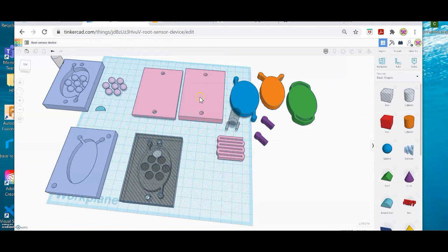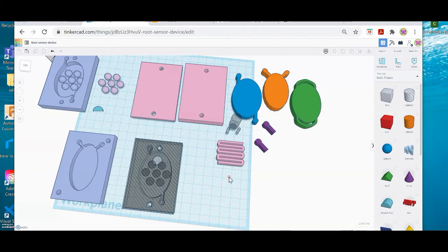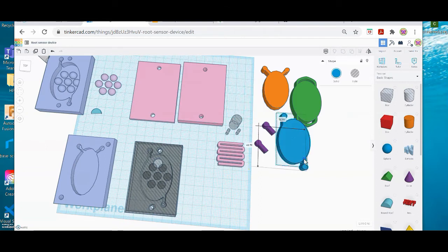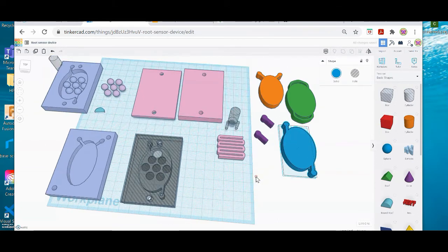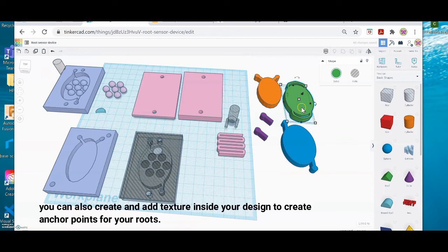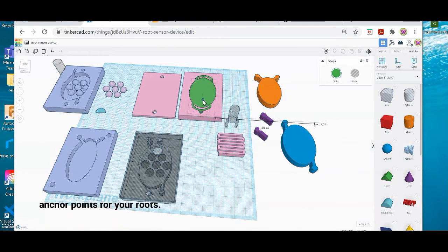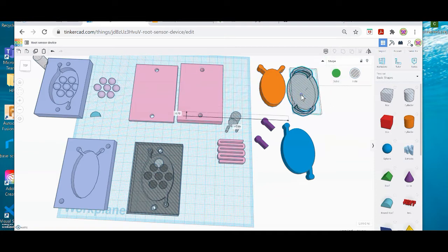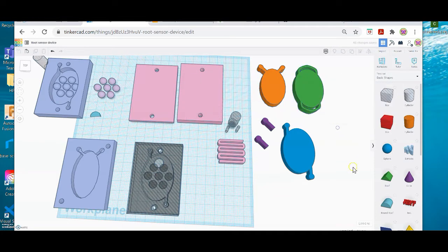So going back to Tinkercad, I want you to think of this like the toy Potato Head. These are the different parts that you can use, and the way you would use these is you decide which one you want to use, and you can slide it over here onto your base plate, and then you can make it a hole, and then you can group it to make it the cavity that you're growing your seed in. But I'm going to work from scratch so I can show you that process.